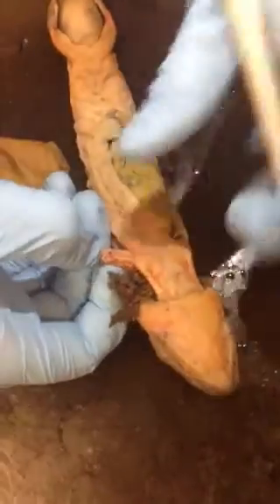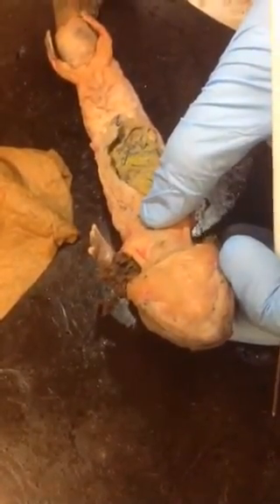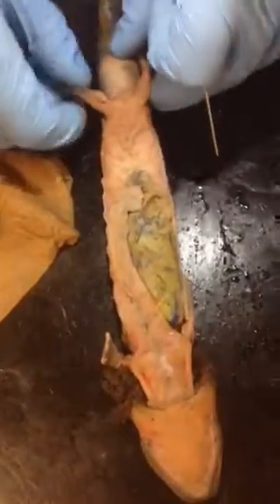Now, there is one in this book that I did not cover, and you will not have to know it for your test. It's called the pectori scapularis. It's too tiny to pin and too tiny to see. Let's move to the lower legs.